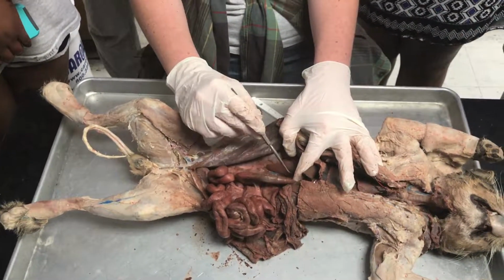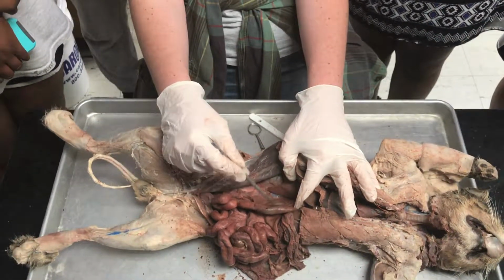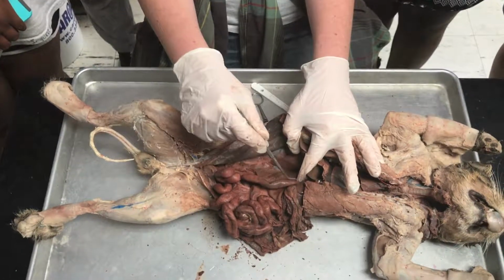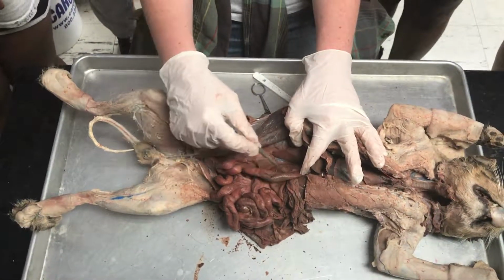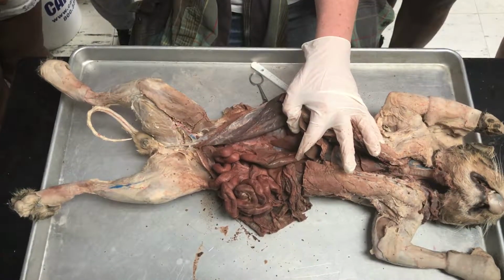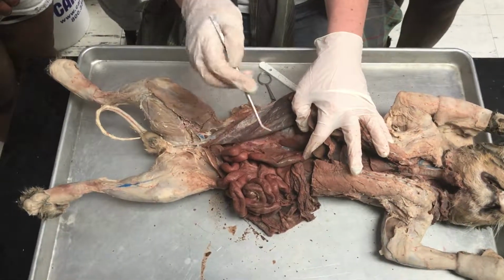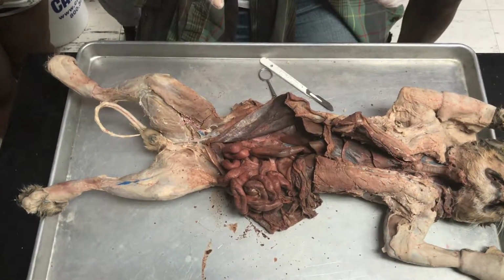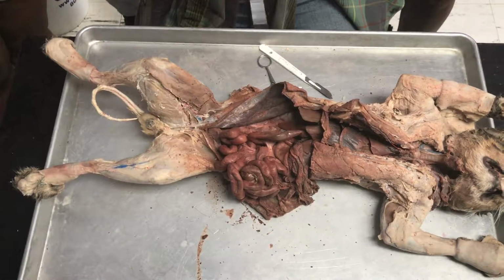It's like a thin, muscular organ. That's your duodenum. It sits right underneath the pancreas, sorry. You have the pancreas, which sits right underneath the duodenum. So that's this organ. And it's intimately linked to the duodenum because it's going to secrete a lot of digestive enzymes such as amylase, lipase, nuclease, etc. So that's what makes the duodenum the most important site for digestion and reabsorption of nutrients in the digestive tract.